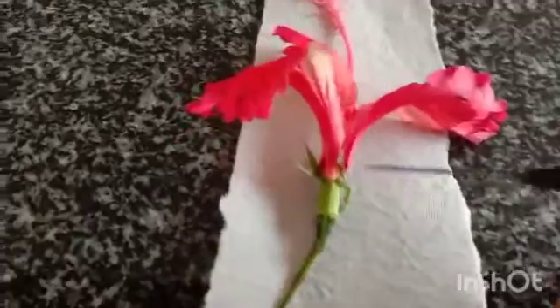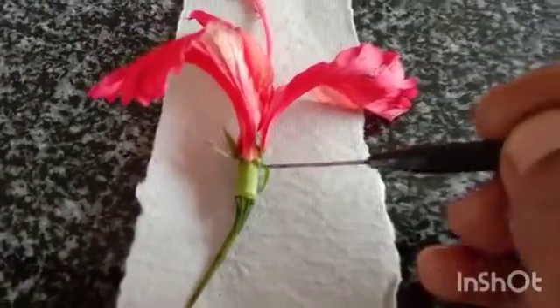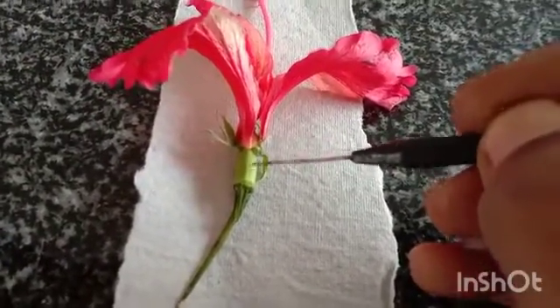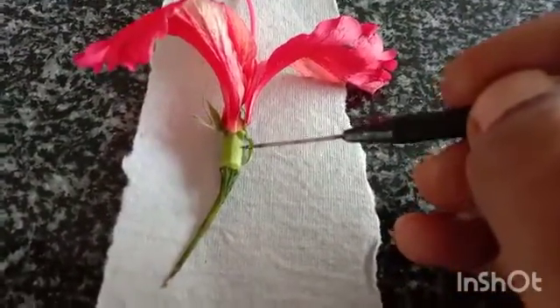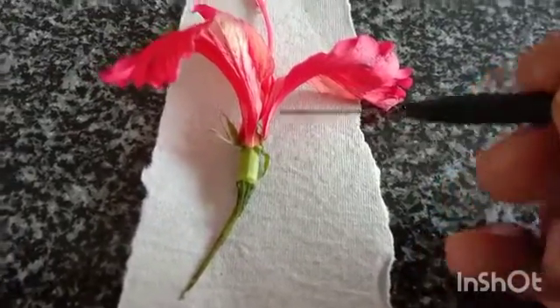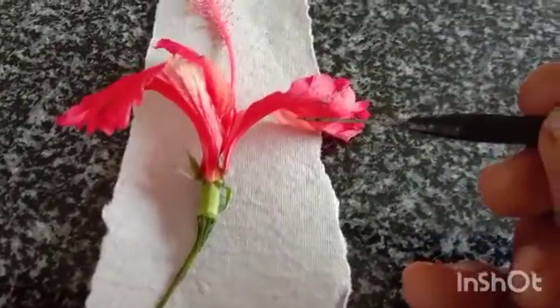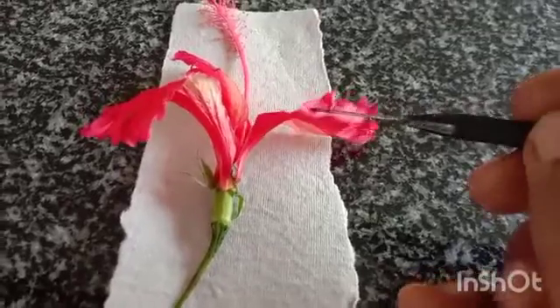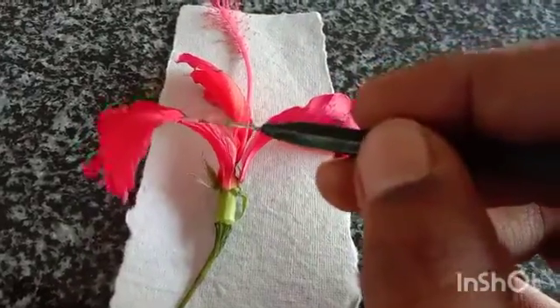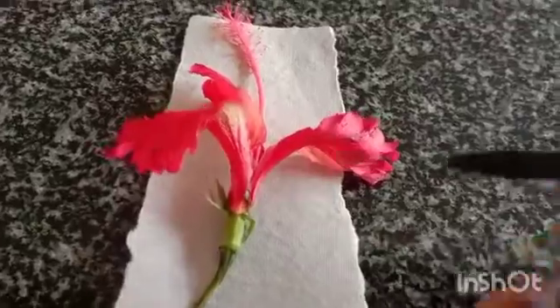Now we are seeing the different parts of flower. This is calyx, the green color part. And these are corolla, brightly colored corolla, which attract the insect for the pollination.